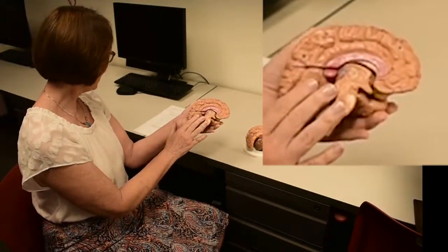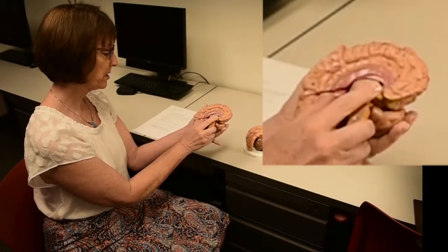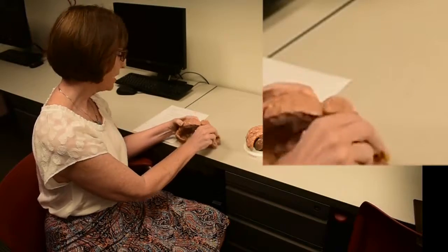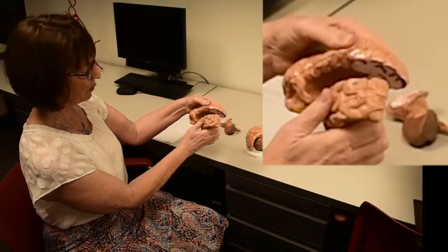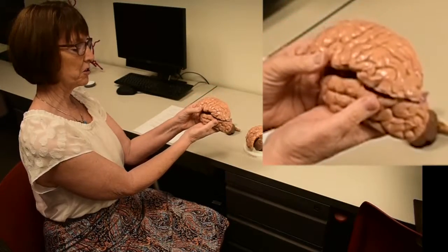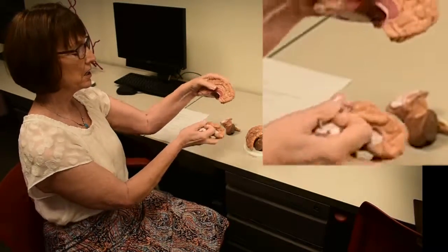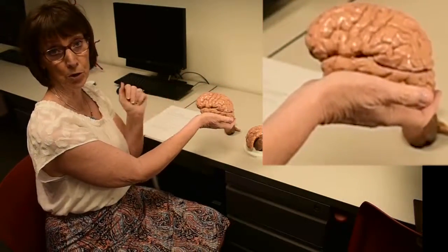Now, when we look at this part of the brain, we have two parts that the cerebrum can be divided into. Okay, so we've got the cortex. We have these two parts. So the question on the sheet there is, what two lobes can constitute this upper portion? So it might help to look from the inside as well, but this piece right here is really representing two parts of the cerebral cortex.